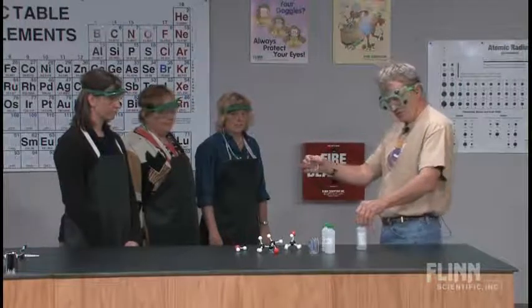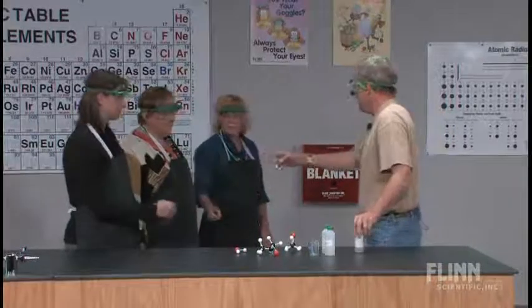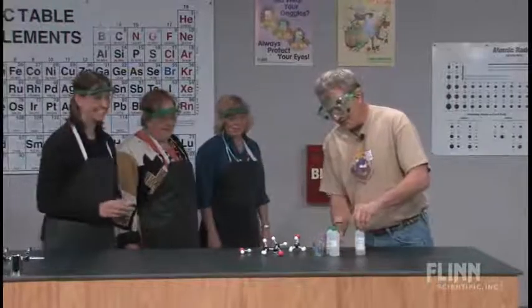And so the first one says acetone, and I'm going to hand you the acetone beaker. Well, you want to go this way? We're going in? Okay. All right. Tell me what to do. That's good. All right. So we're going to go the acetone beaker.